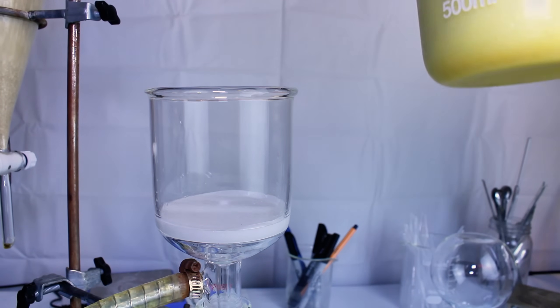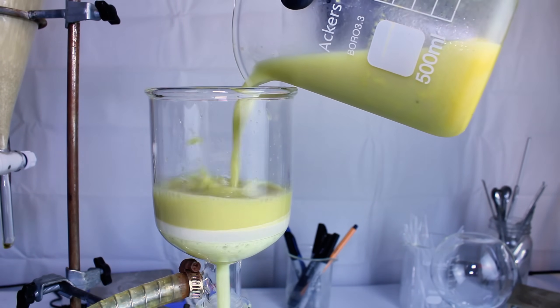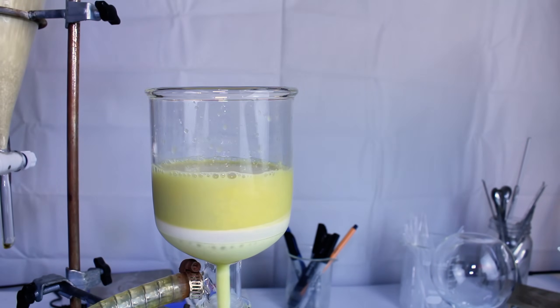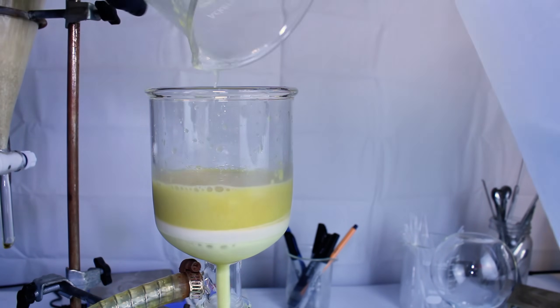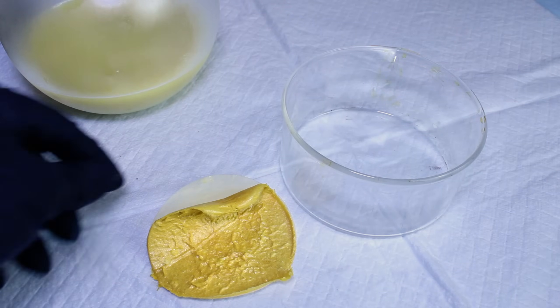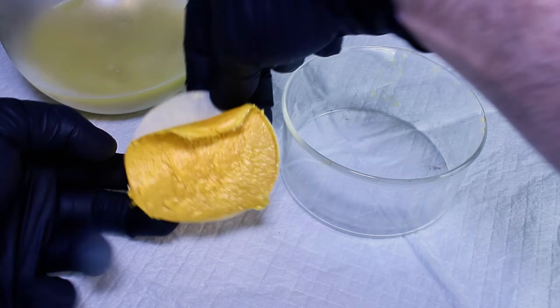When I come back the next day, I pass the solution through vacuum filtration to collect my piperine, and even though it looks like a lot got through here, I thought a lot got through here as well and went out of my way to precipitate all the piperine in the filtrate, and it really didn't amount to much. It seems the particles that do get through are very, very tiny.